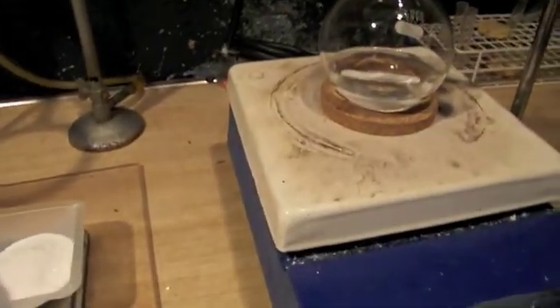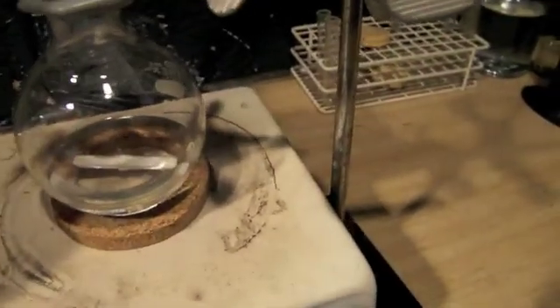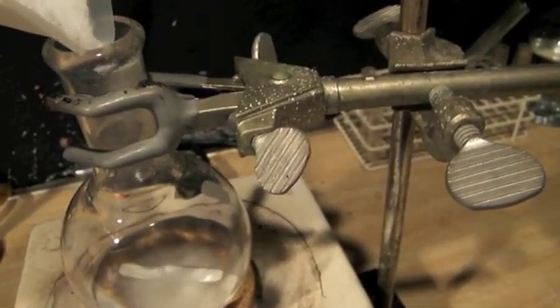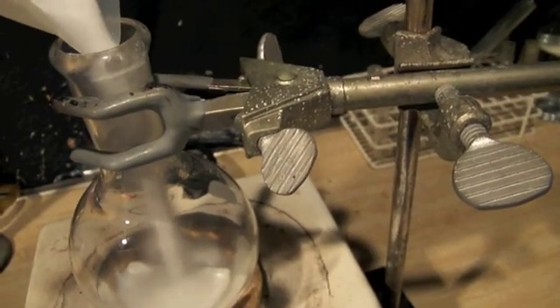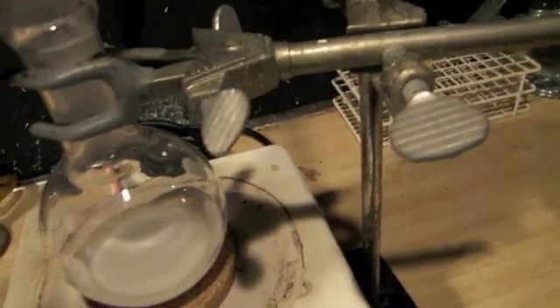First, add 50 grams of potassium bromide to the round bottom flask. And add just enough water to dissolve the potassium bromide with vigorous stirring. For this you can either use a magnetic stirrer if you have one, or you can swirl the flask or use a glass stirring rod. If necessary, you may heat the water to encourage more potassium bromide to dissolve.